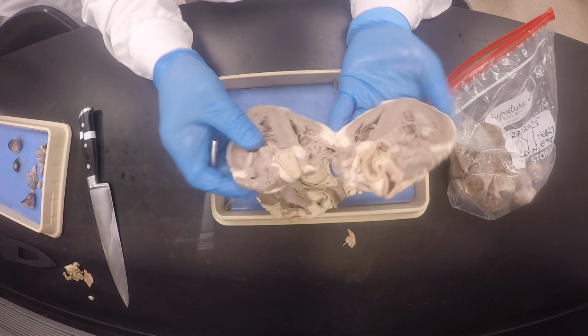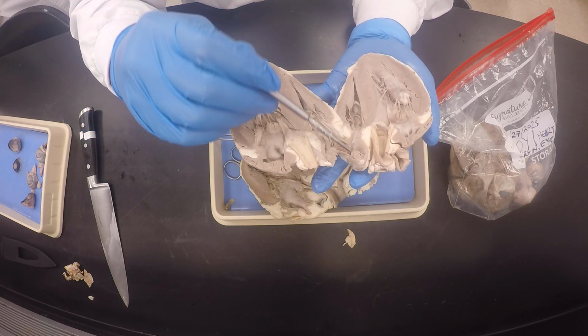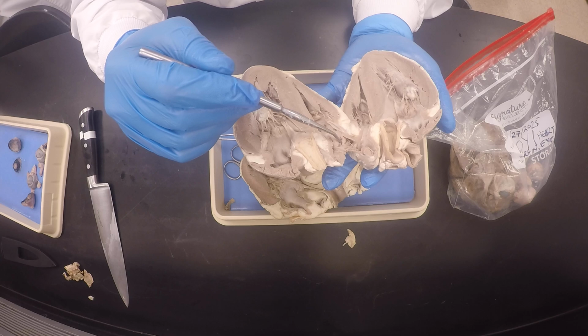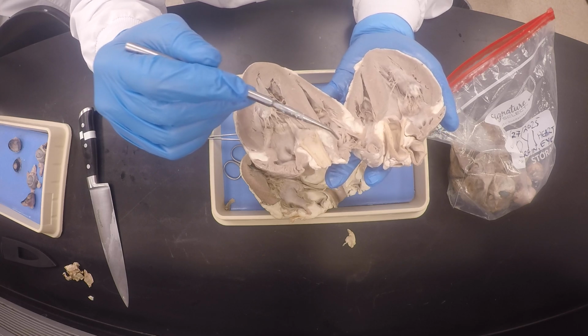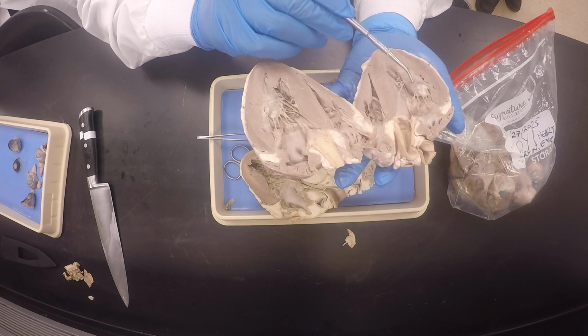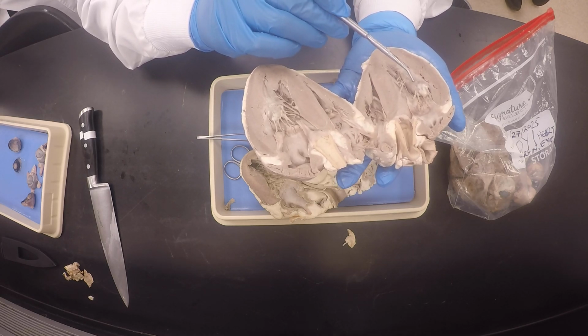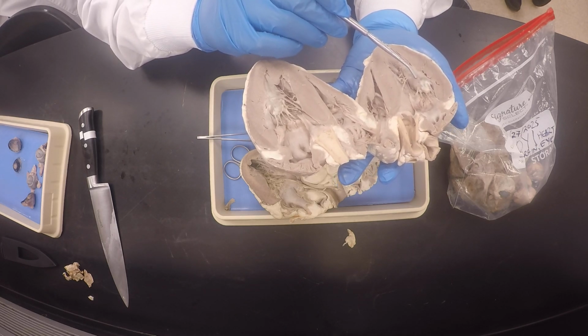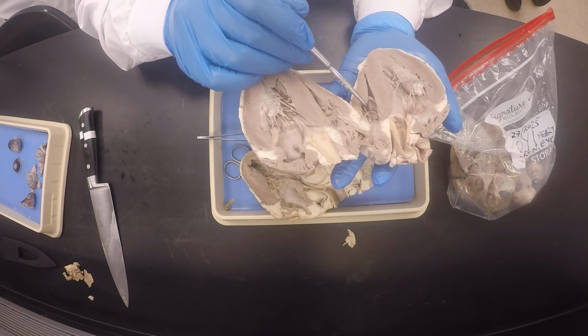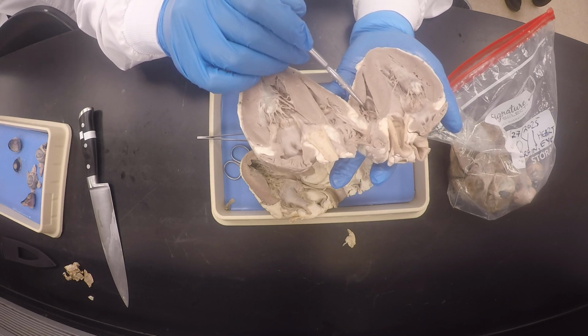Okay, my good friends? And then if you look at the auricles, do you see these smaller muscular ridges? Those are musculi pectinati, or pectinate muscles, versus the much bigger trabeculae carneae, especially on the left ventricle, where they are more prominent than on the right ventricle.